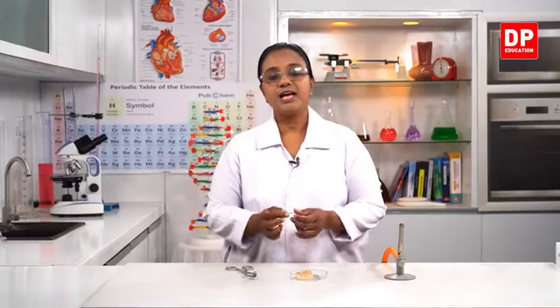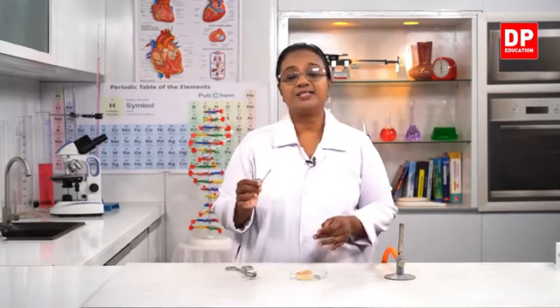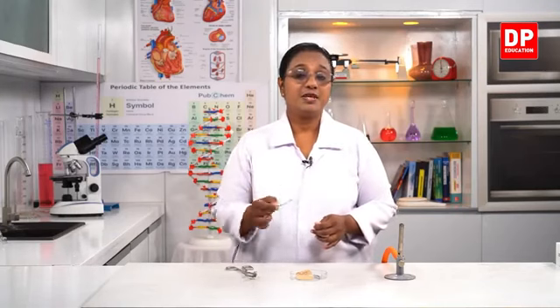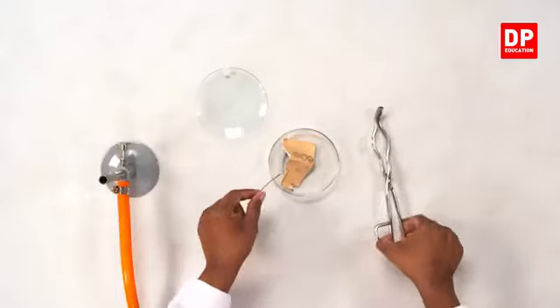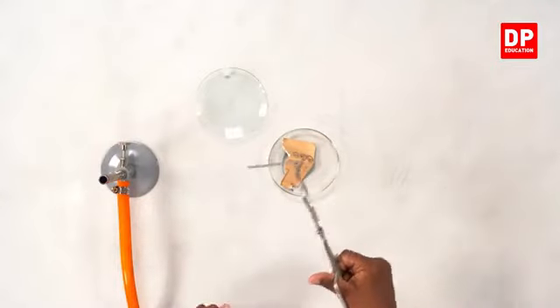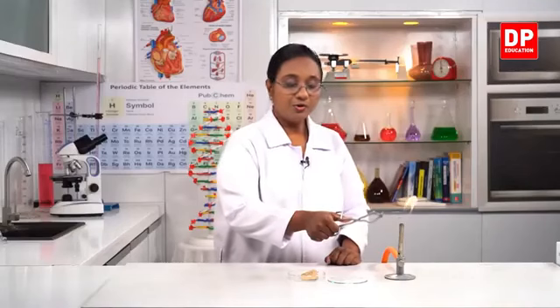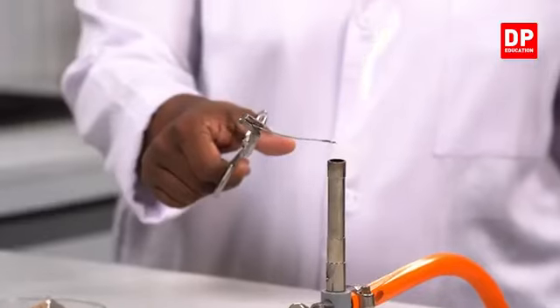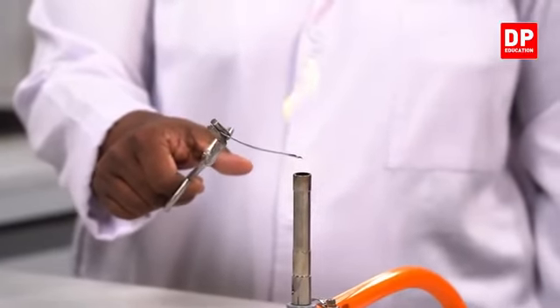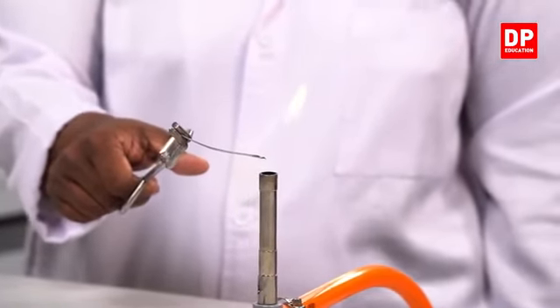So what I will do is I will hold it with a pair of tongs and hold it to the Bunsen flame so that you can see how the magnesium strip burns in air. We are familiar with this reaction. So we will look at that change now. So now I am going to burn the magnesium strip. I am going to hold it to the Bunsen flame. You all have to observe the change clearly. We will need to hold it for some time.